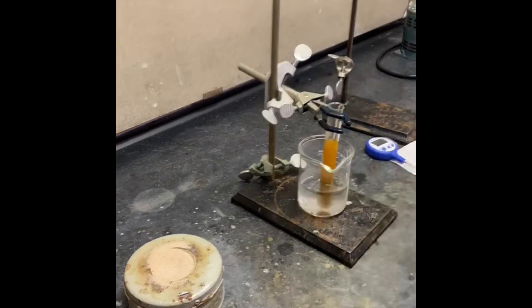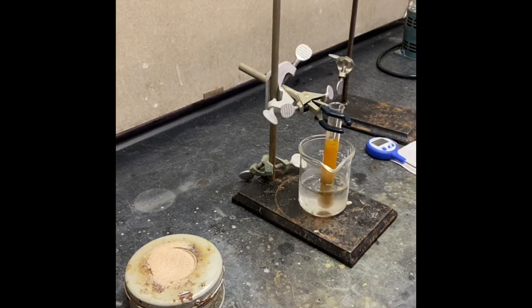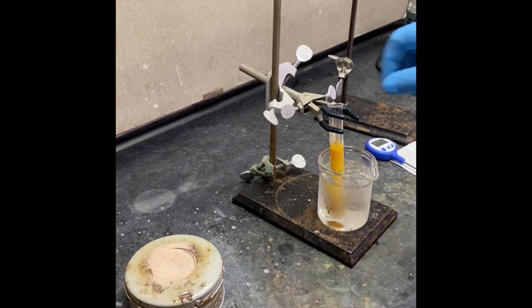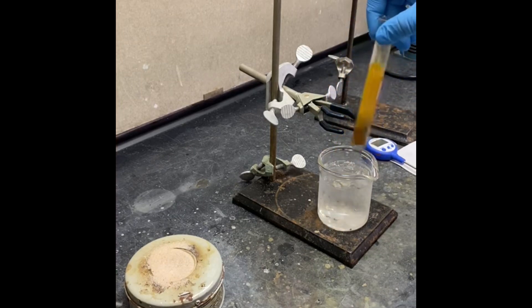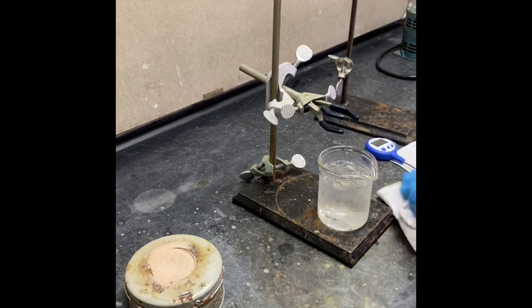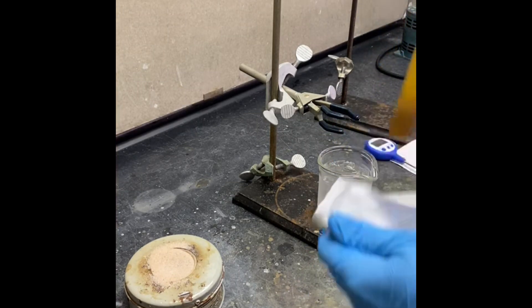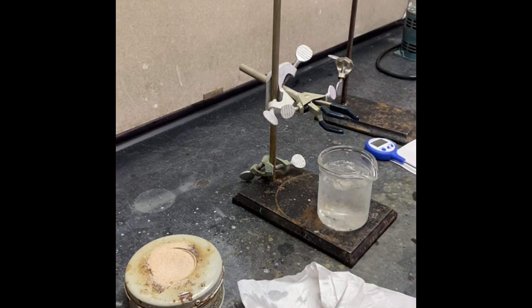Let's dip it in and then we're going to add some more water. After it reaches room temperature, we're going to filter it. The reaction product is ready to filter now under vacuum.